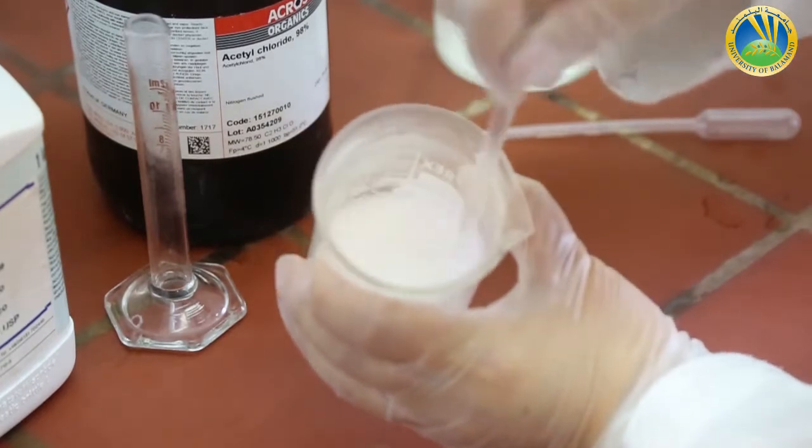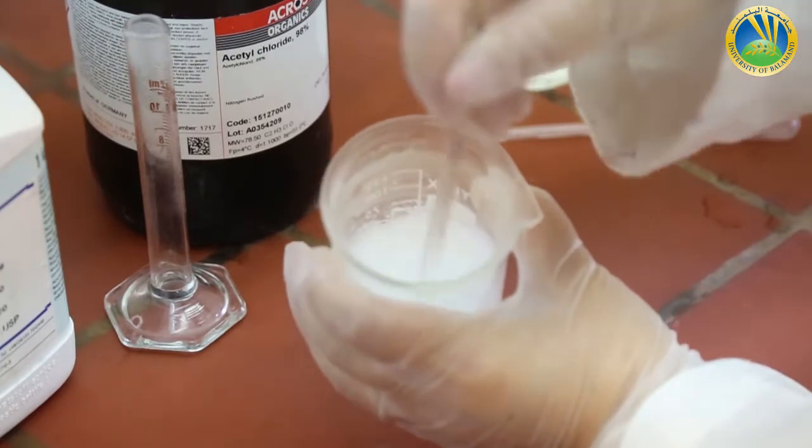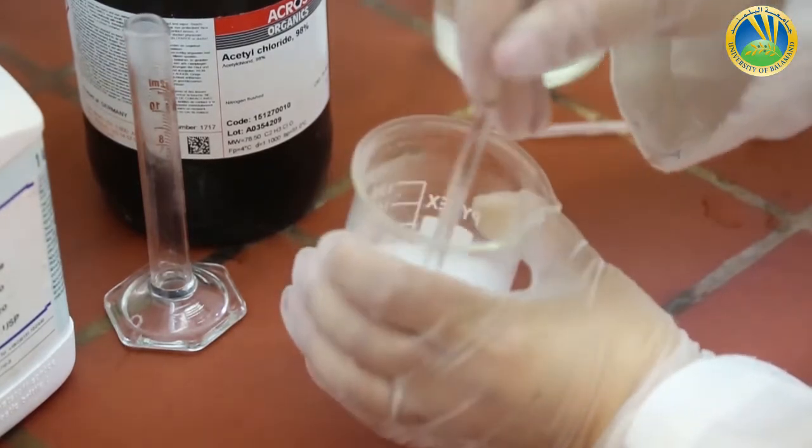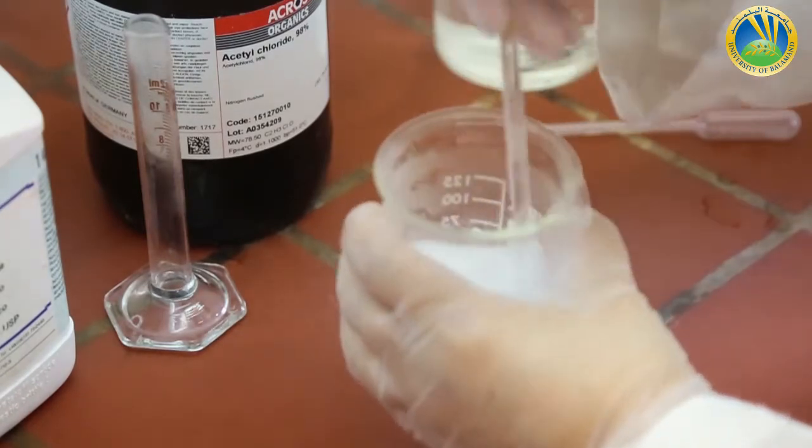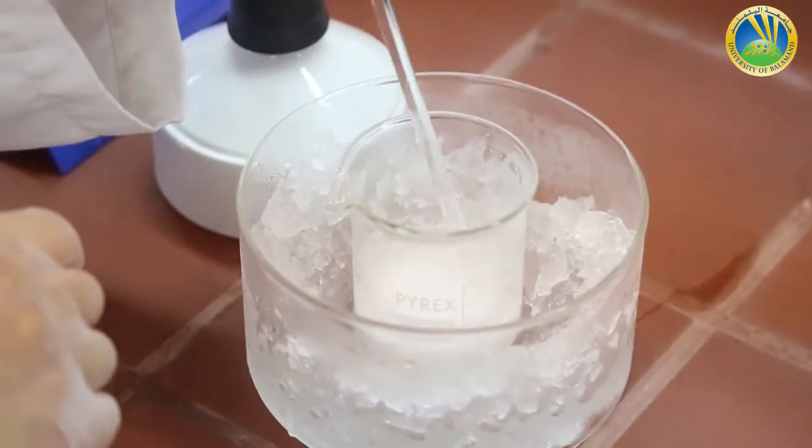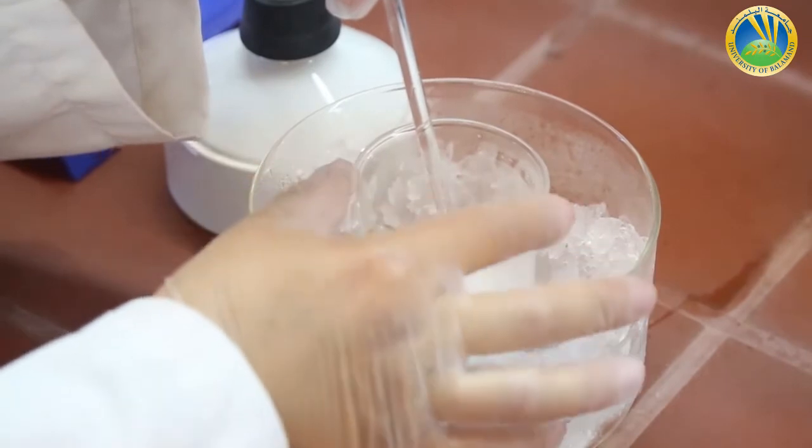Now I have the aspirin granules in suspension in cold water. I will go to the bench to do the Buchner filtration. The solution is still hot. I have to cool it a little bit inside an ice bath.